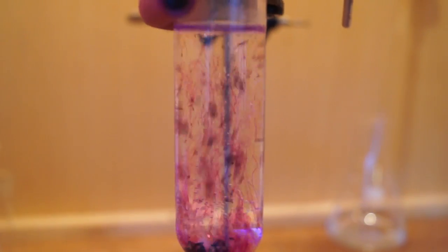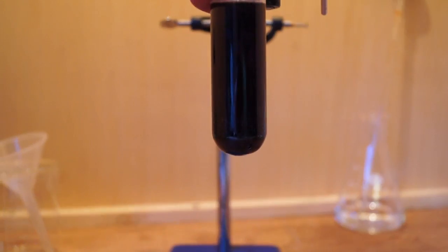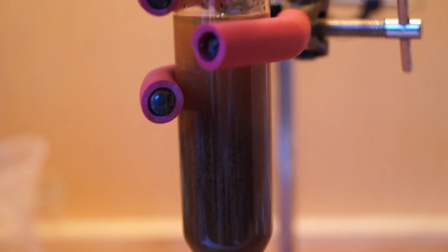On addition, purple streaks filled the water creating a nice visual display. I left the mixture for about 10 minutes for the alcohol to be completely oxidized by the potassium permanganate.